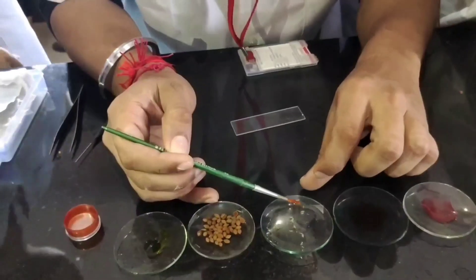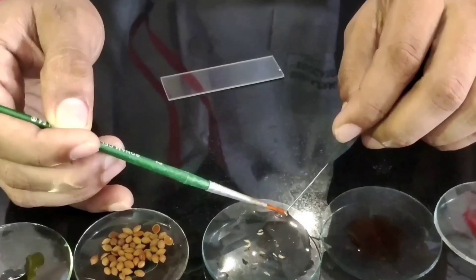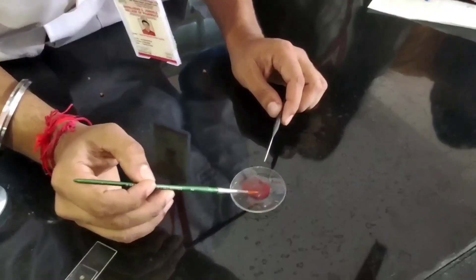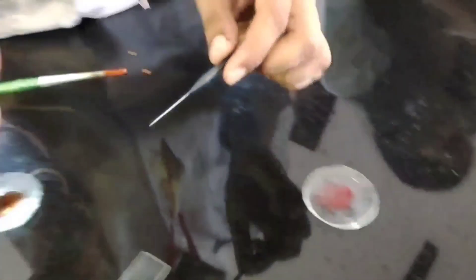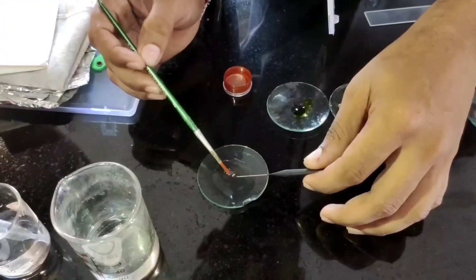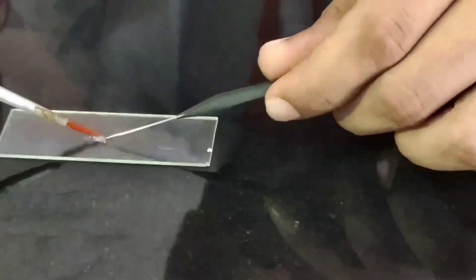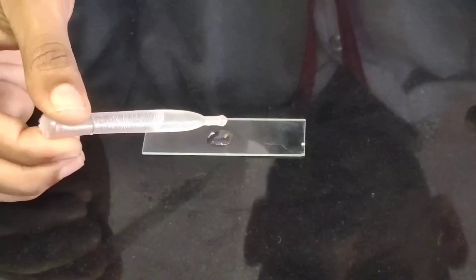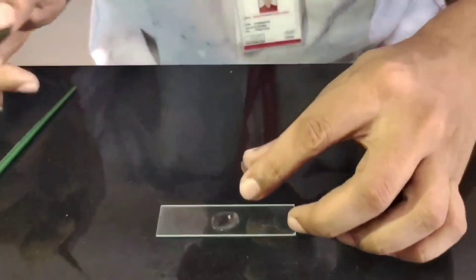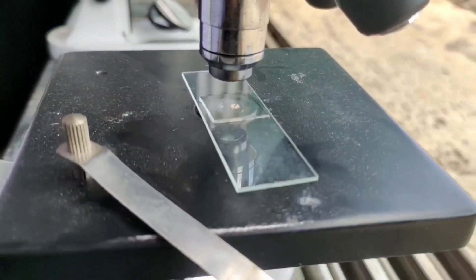Now, firstly, perform the test with Sudan Red Solution. Take the transverse section, then dip it in the Sudan Red Solution for 3 to 4 seconds. After that, dip it in pure water, then put it on a slide. Add 2 to 3 drops of glycerine, then add a cover slip on it, and observe it under the microscope.